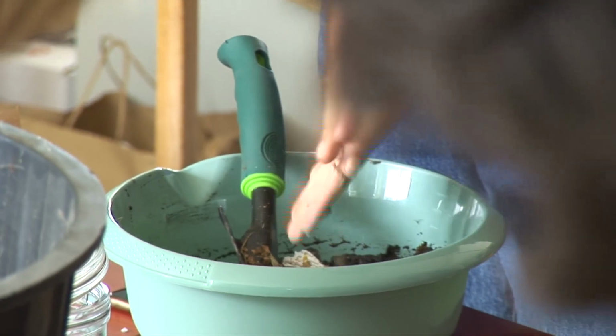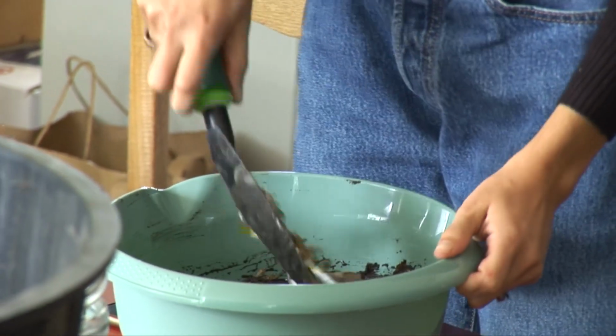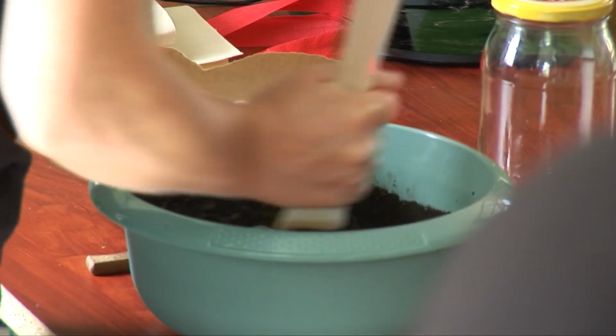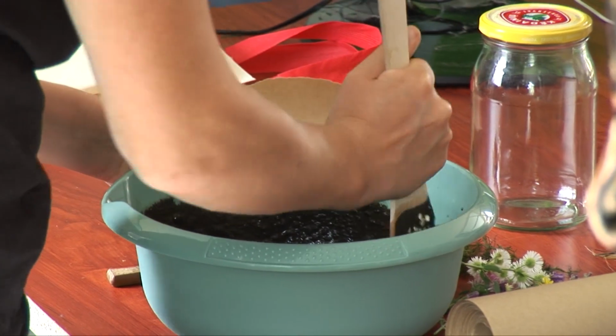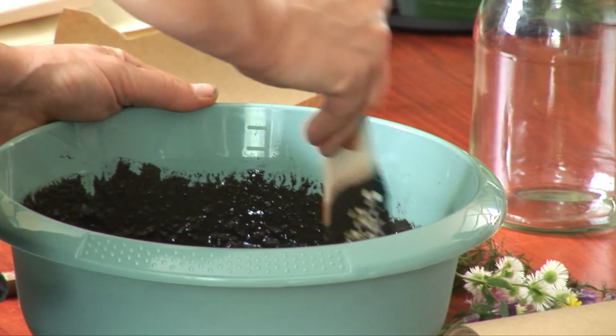And then each person is going to get a bowl and they're going to create a paste. They're going to add some water, some of the ambient water, to the mud to create a paste. To that paste, they're going to add different materials that they think will be good nutrients or will contain nutrients for the different kinds of bacteria.